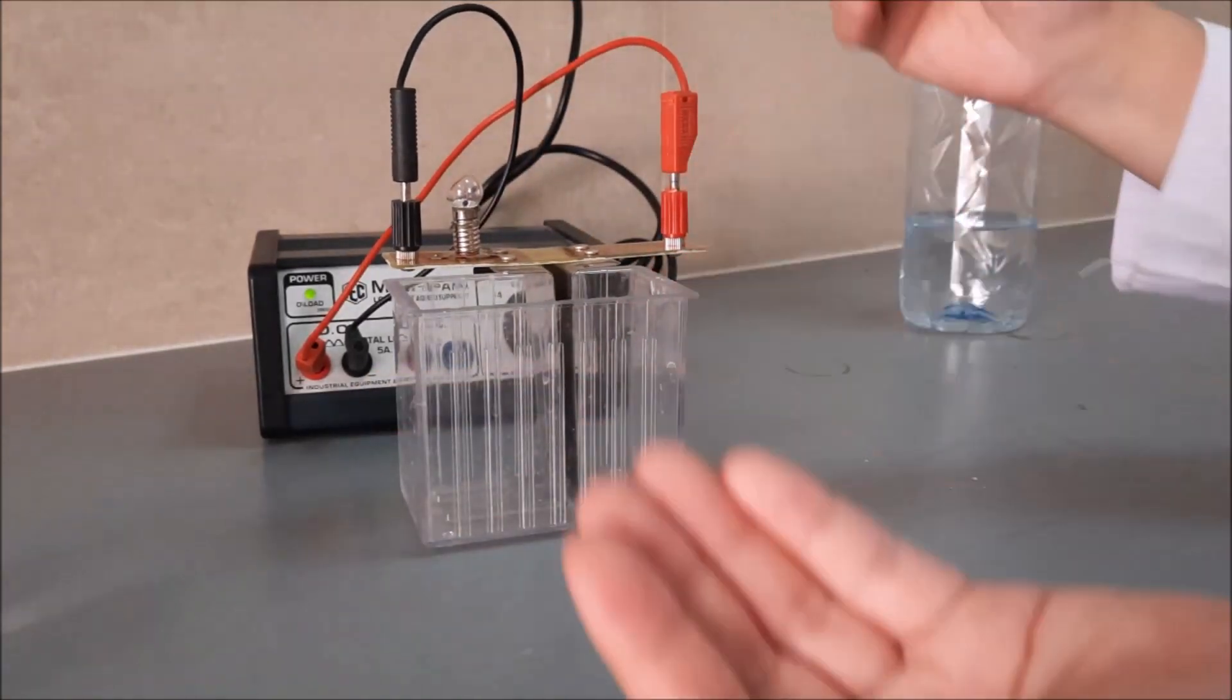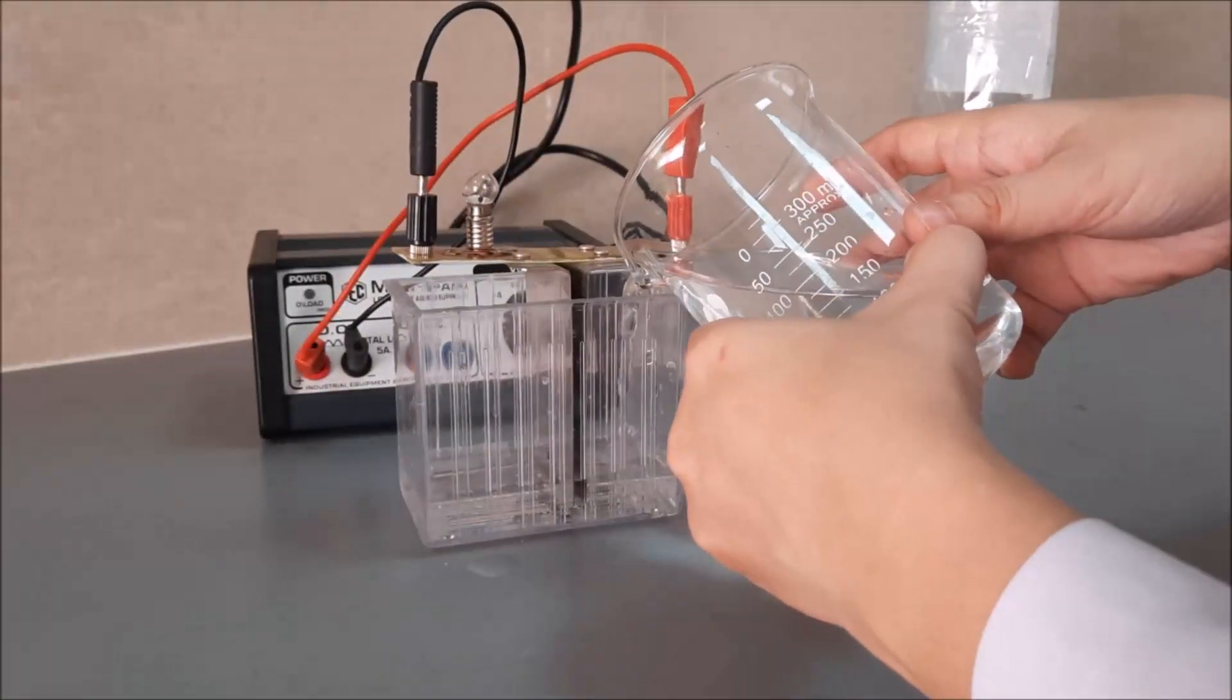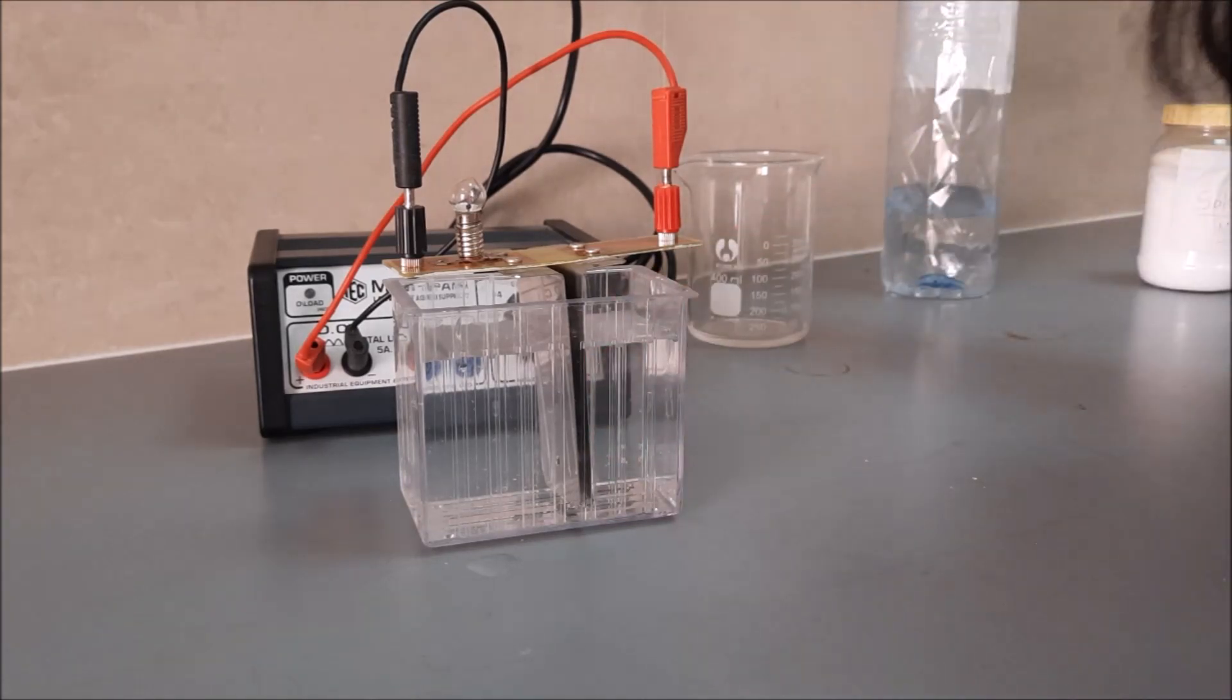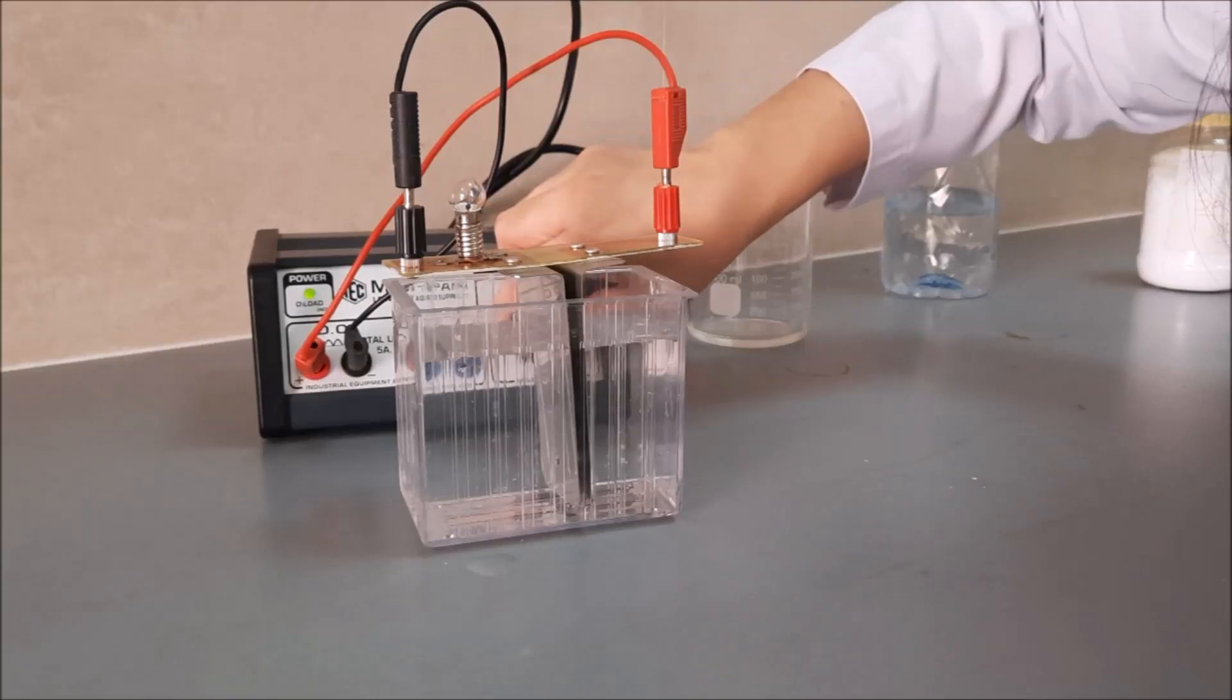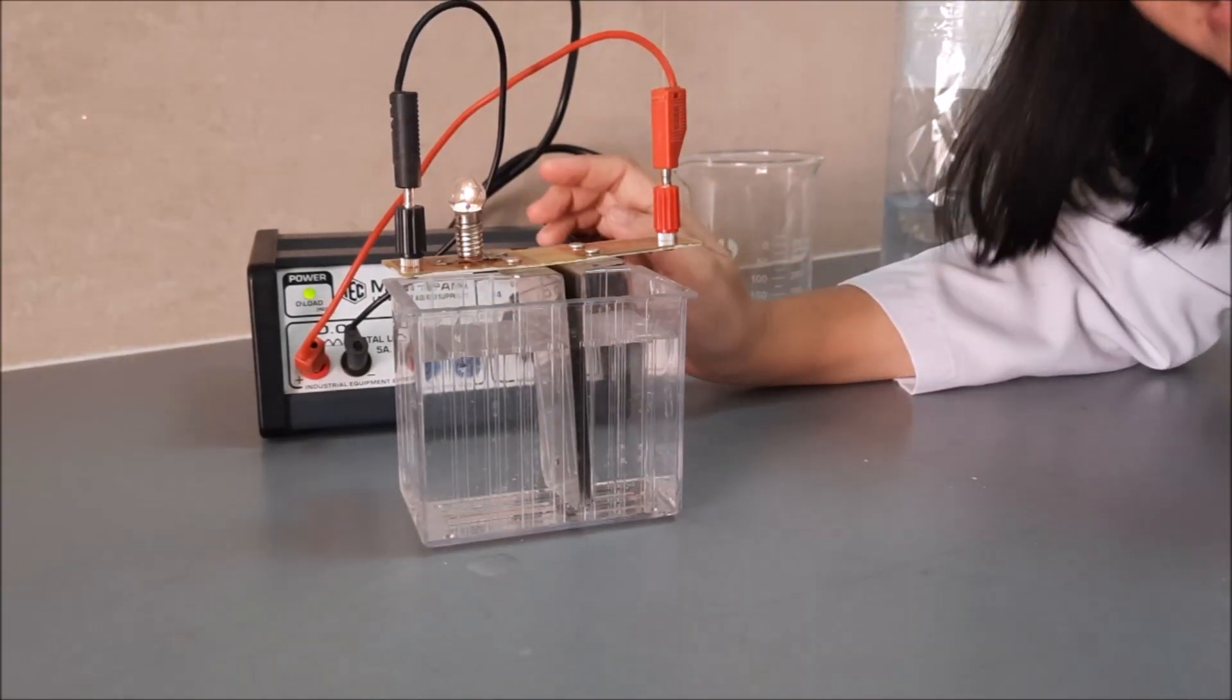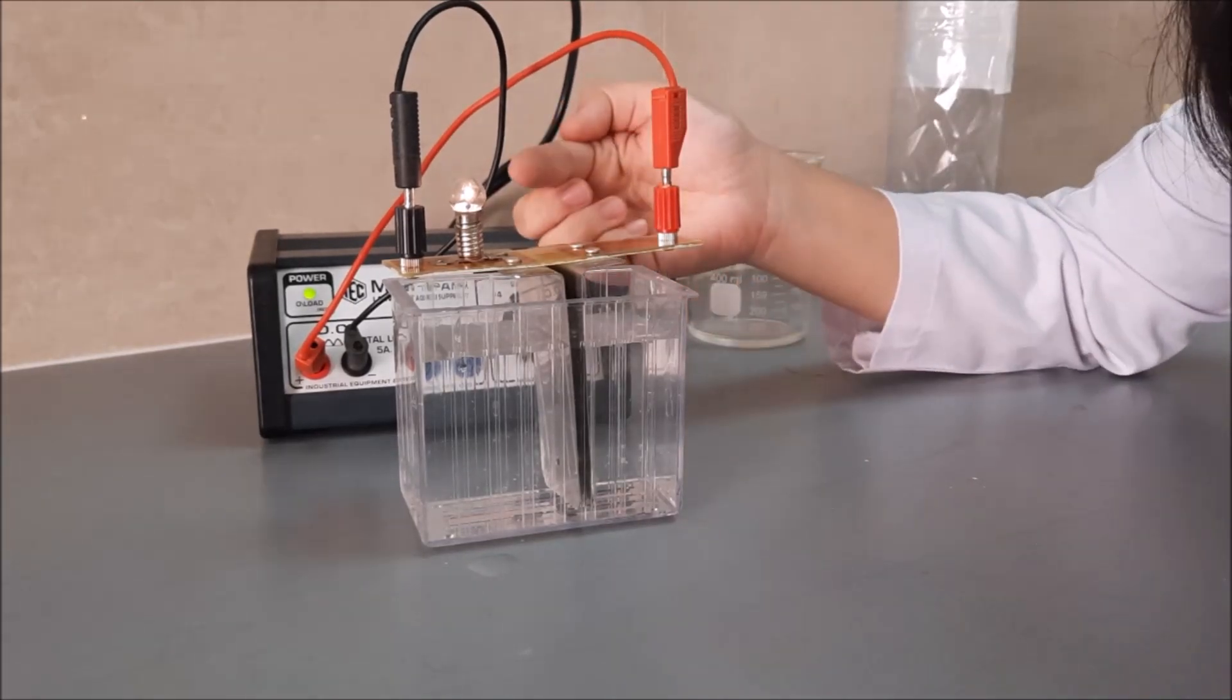But let's try to put the salt solution. Now, we can see, let's check if it will conduct electricity. There. Now, we can see that with this brine solution, it now conducts electricity.